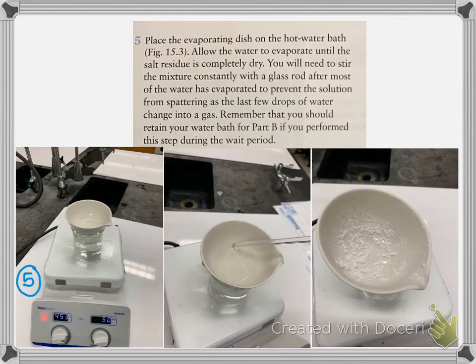I had a beaker with boiling water here, and it slowly evaporated the water from the solution. So you can see in this picture, I'm using a stirring rod to kind of break it up as it starts to evaporate, and then eventually after some time all the water's evaporated and I have this dry salt. If I pick up the evaporating dish and shake it around, the salt moves freely.